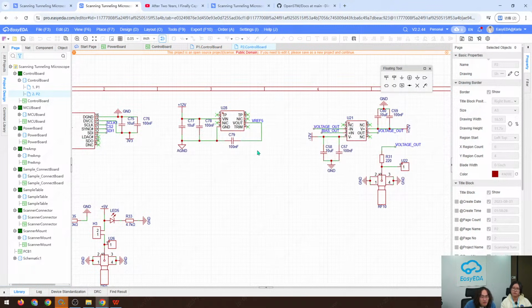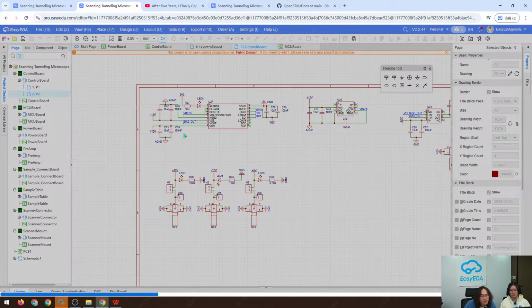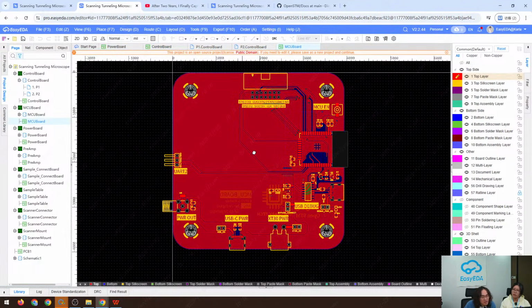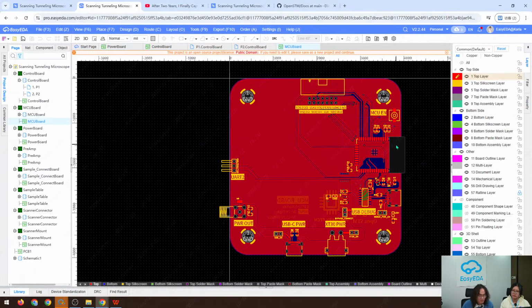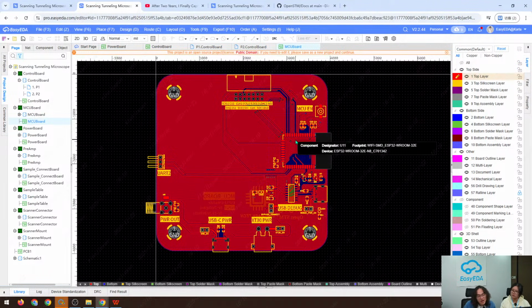Yeah, it is voltage references. So this is a control board, and the MCU board. Since this project started in 2020, the MCU I used is ESP32. Very simple. I didn't use the wireless function, and I just regard it as a simple MCU.